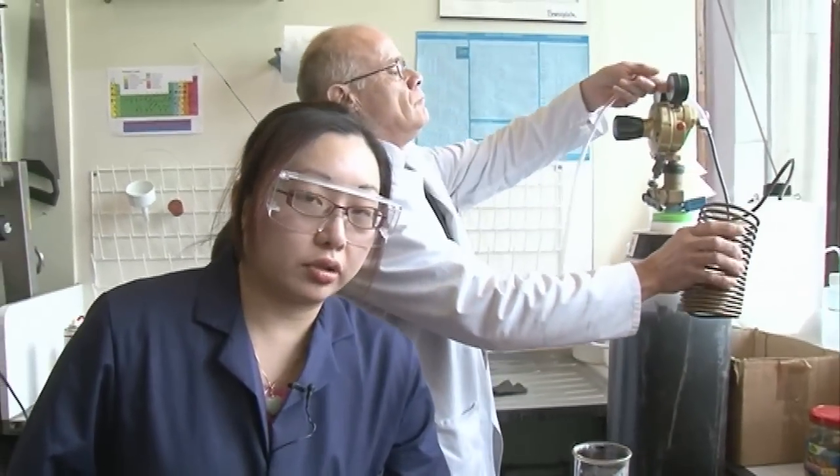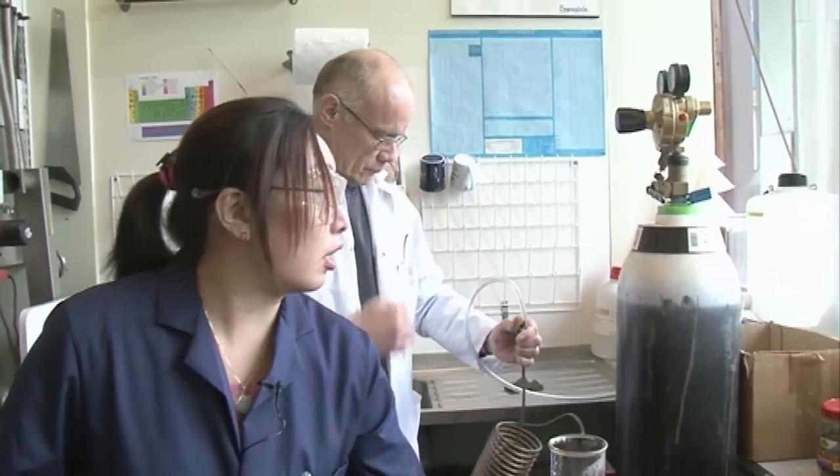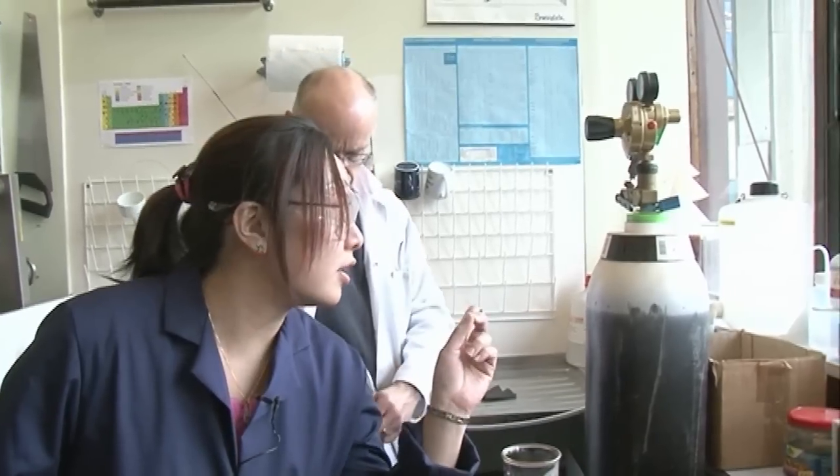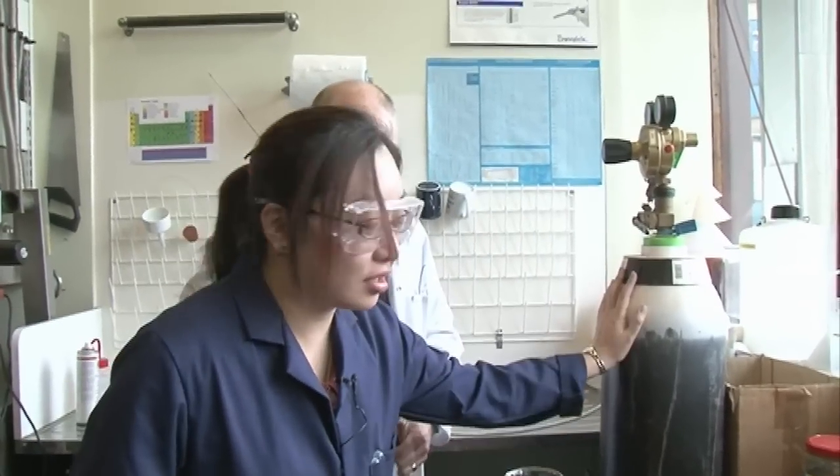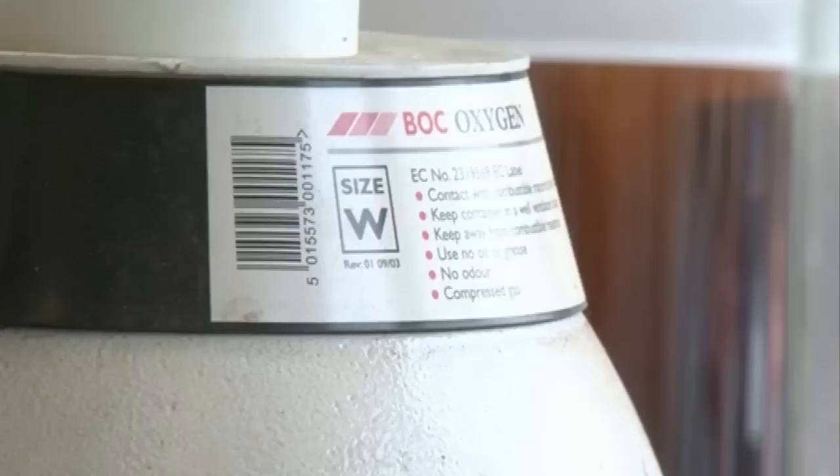Neil's had a very good idea actually. Given that we need oxygen to turn this reaction around, he's got a cylinder of pure oxygen next to us. We're going to bubble some of this into that and see what happens.